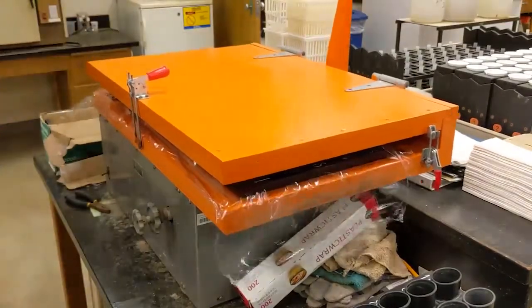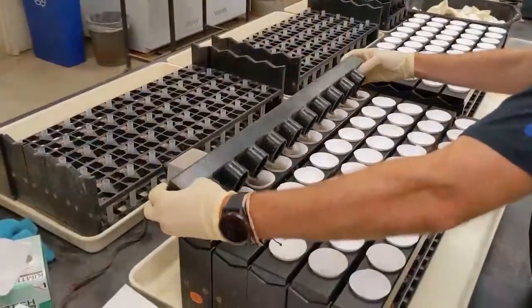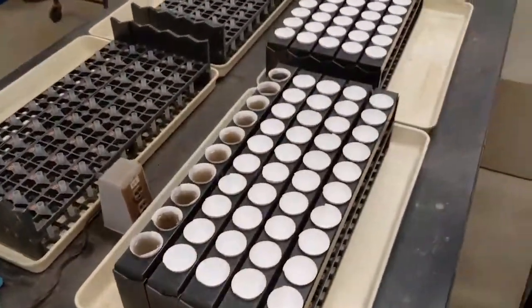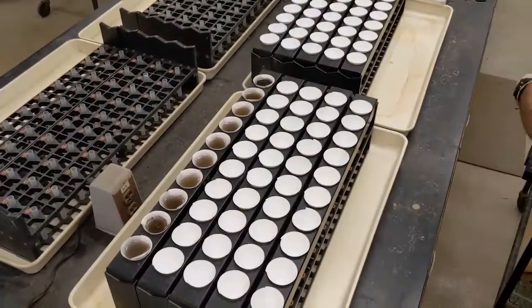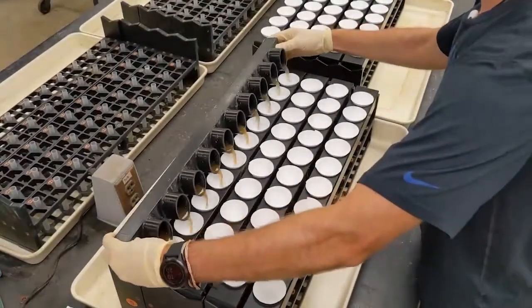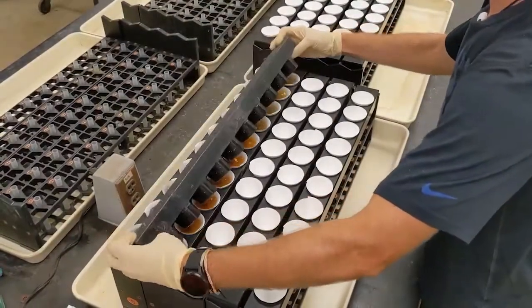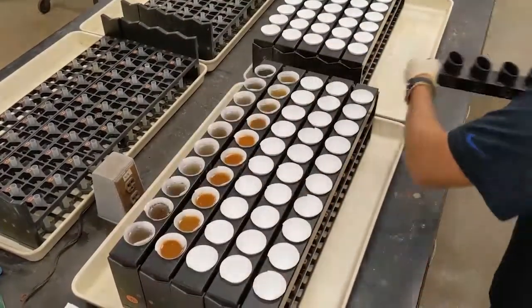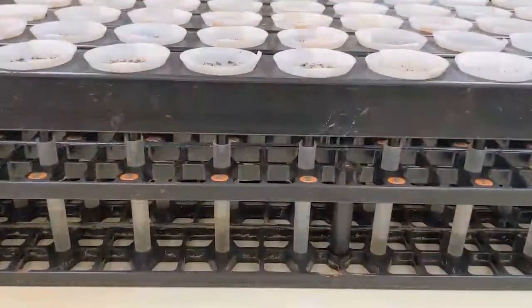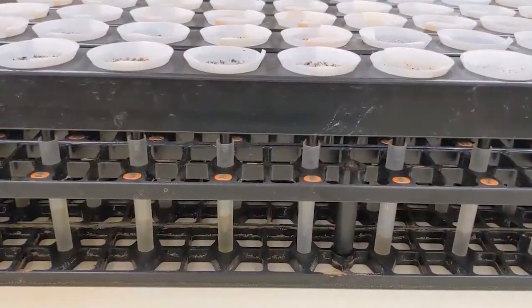After shaking, each tray is filtered through paper funnels. The elements once contained in the solid soil sample are now contained in the liquid extract, which is being filtered into test tubes.